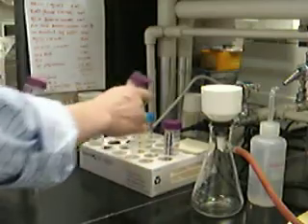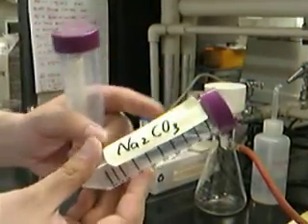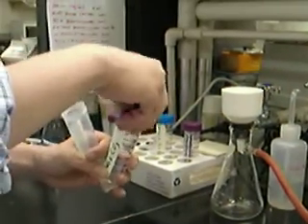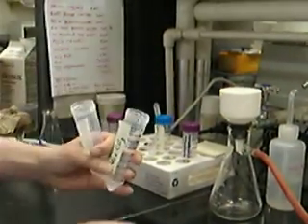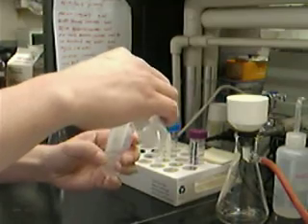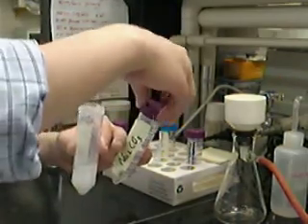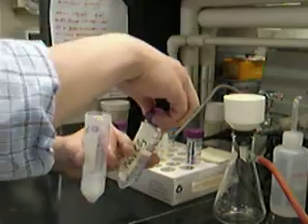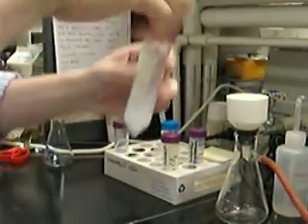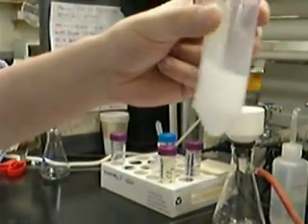Next, I want to add in this sodium carbonate into this calcium chloride solution. I'm just adding a little bit. What you see right now is that it immediately precipitates out and the solution becomes murky.